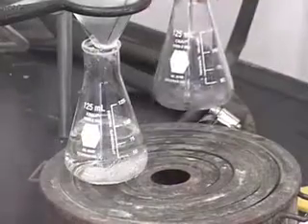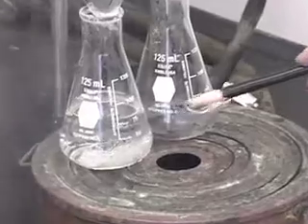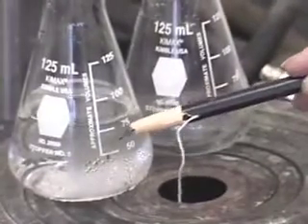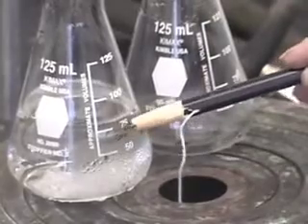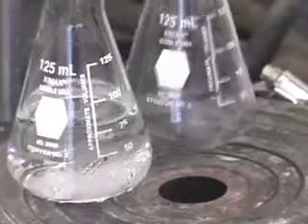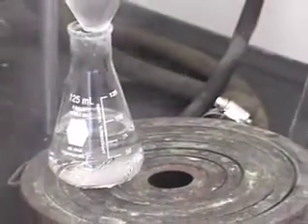Okay, now that I have put this original flask next to each other, notice there is a mark here that I had made originally. So corresponding to the same mark, make another mark on that flask. Again, this is approximate, but we want to make sure that we do concentrate the solution to that level.